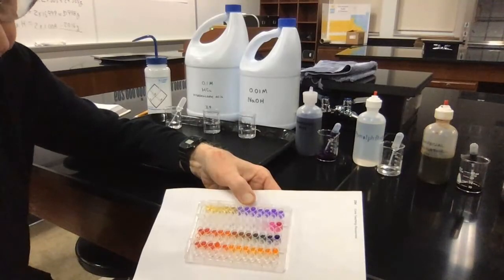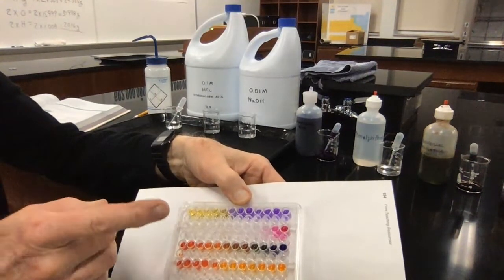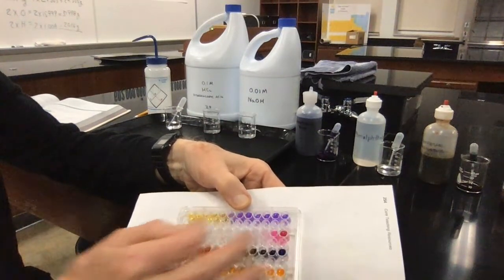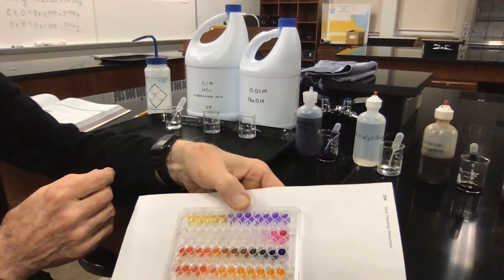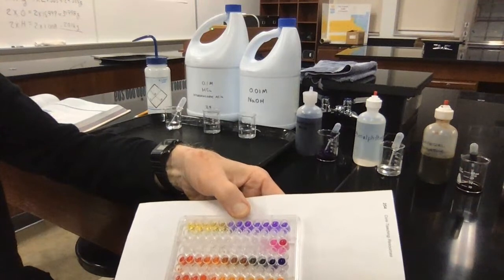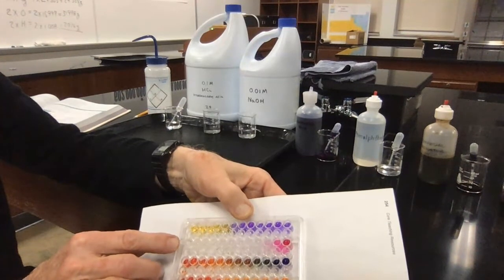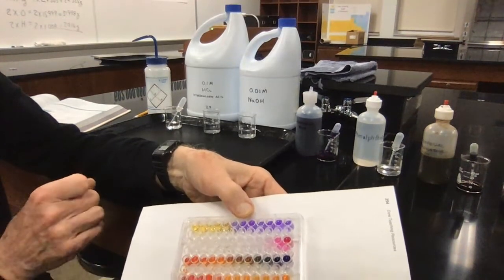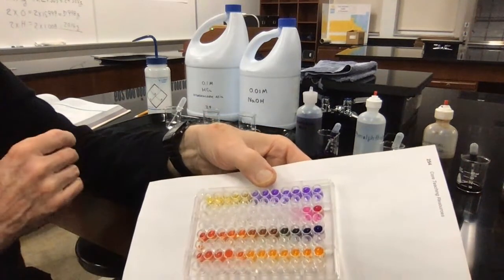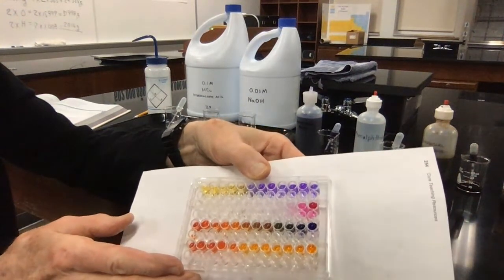All right, we've put all the indicators into the various wells going across, and as you can see, as I go from a strong acid to some basic side with the bromphenol blue, I am getting a change from yellow to kind of a dark purple or a purple color. The second row is the phenolphthalein. That starts off in the acid range as having no color whatsoever. It's colorless. But over here where the pH is in the basic range, it's changing to a kind of a magenta or pinkish color.